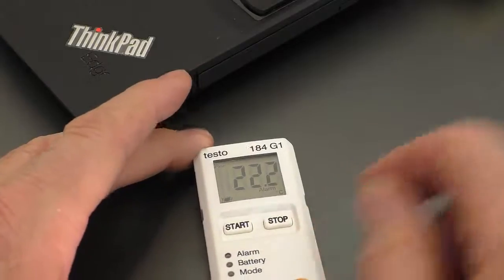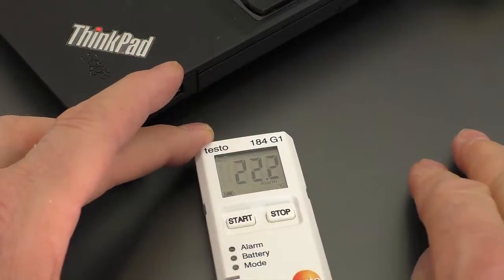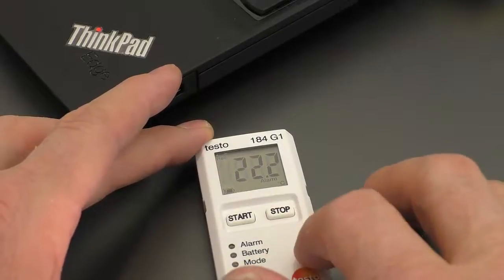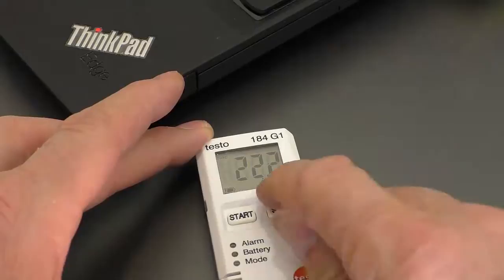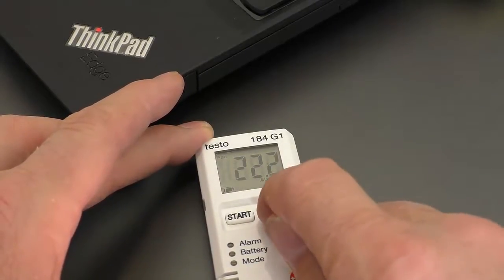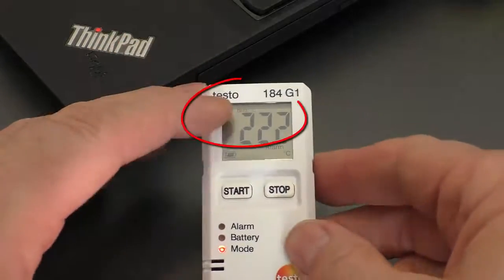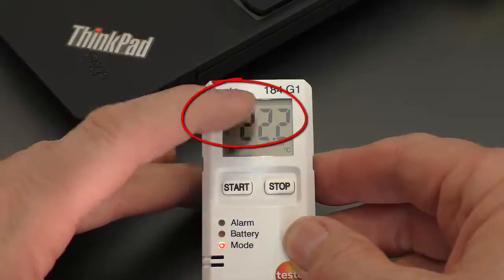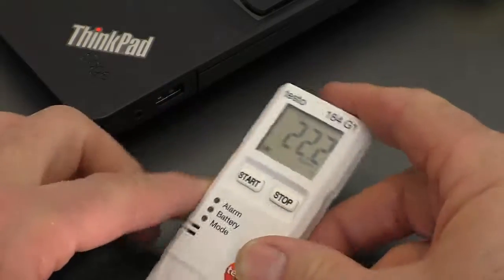We've finished our recording — we may have finished the trip. And as I say, we could use an Android phone with NFC to capture the data. The device is flashing, indicating we've had an alarm situation. So I'm going to push stop now. Hold it down for a couple of seconds. It's now gone to "end", which indicates the recording has finished.